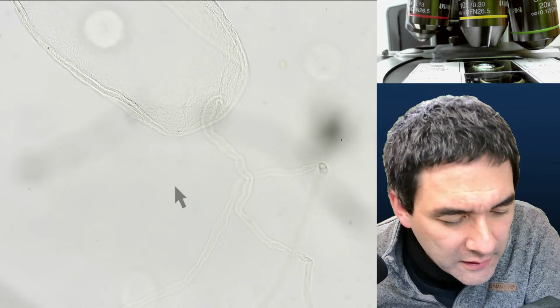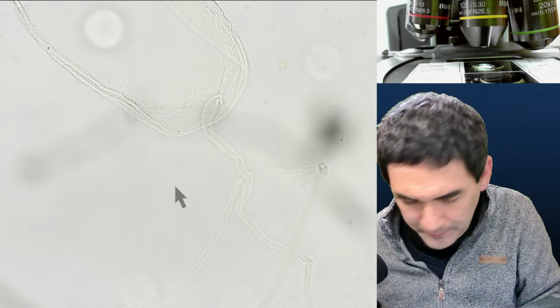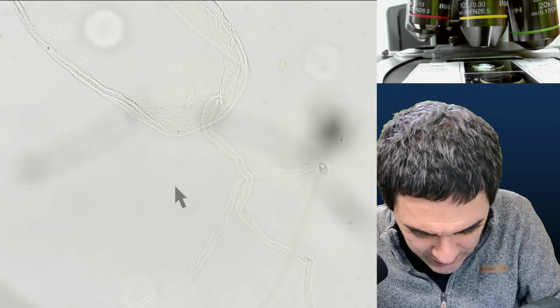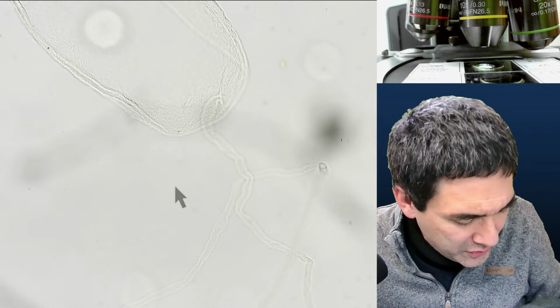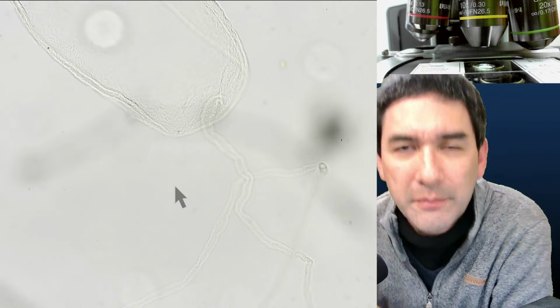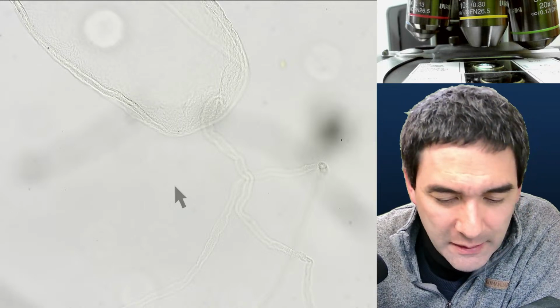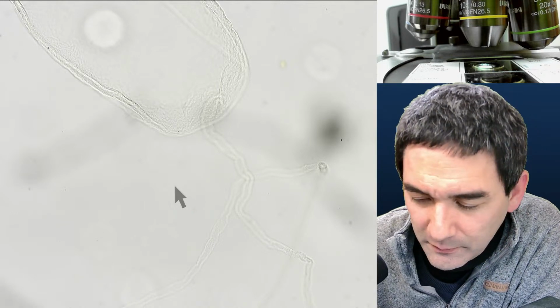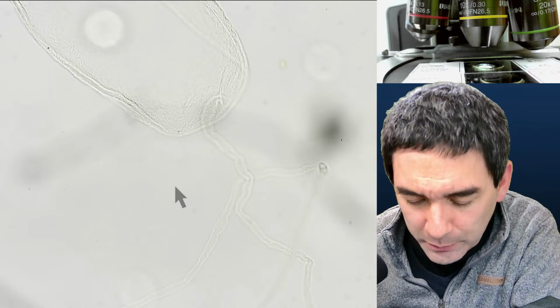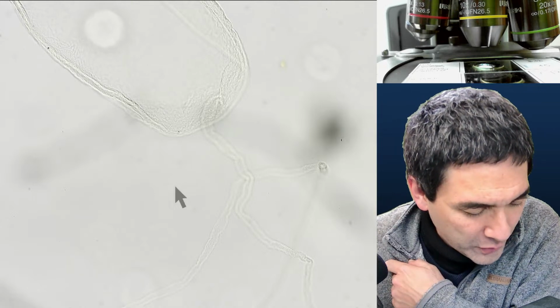and I can't find it anymore, unfortunately, which is a pity. But it doesn't matter. You know what? If I find it, I'll show it to you. The wasp stinger is one that I got out of a dead wasp some time ago. I dissected a wasp and pulled out the stinger, and I mounted that as well. Sloppy as I was, I didn't properly label the slide, so I don't know where I put it. But I just had it before I started the live stream.